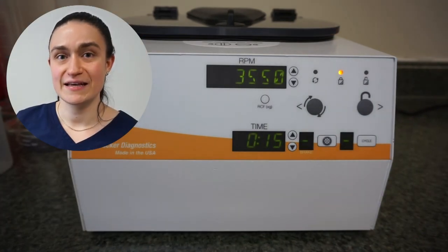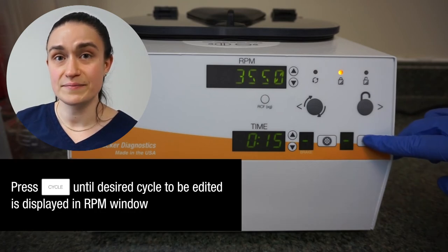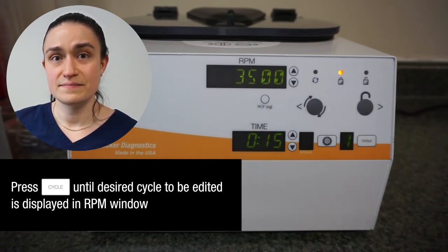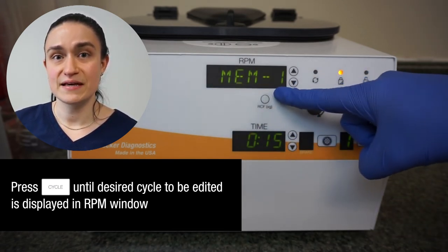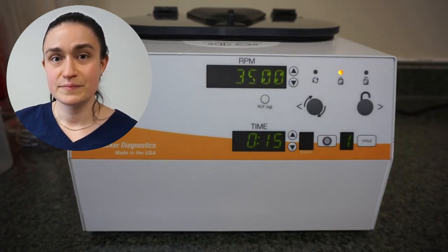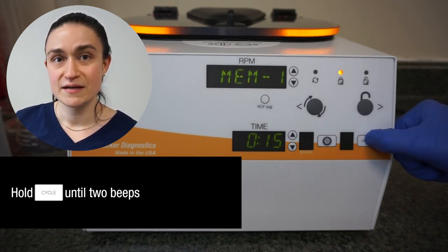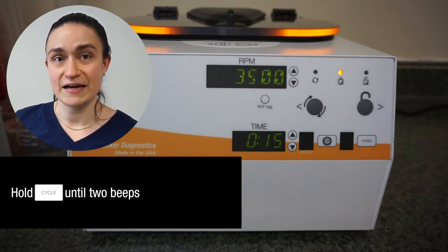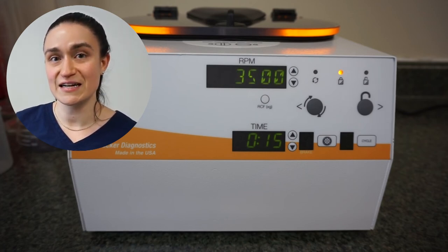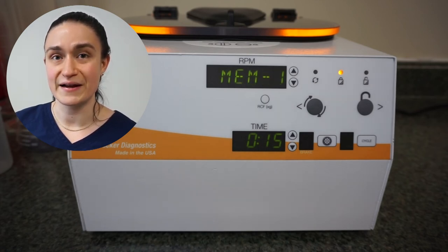And finally, we can edit any of our saved cycles. To do this, use the cycle button to navigate to the cycle you wish to edit. You can tell which one it is because the name and its RPM value will alternate up in the RPM screen. Press and hold the cycle button to enter edit mode. The details of how to edit a cycle are a little bit beyond the scope of this video, but you can click through to either the basic editing instructions or the advanced editing instructions that are showing up on your screen right now.